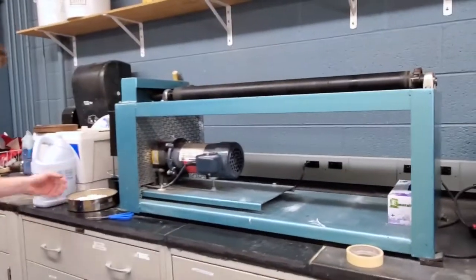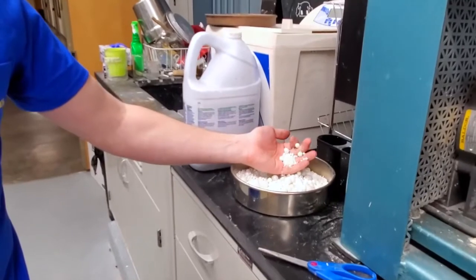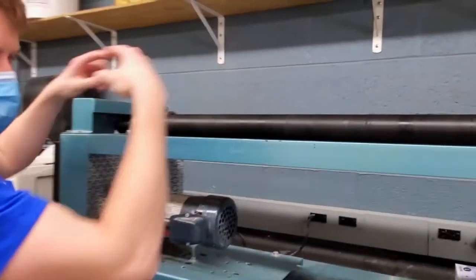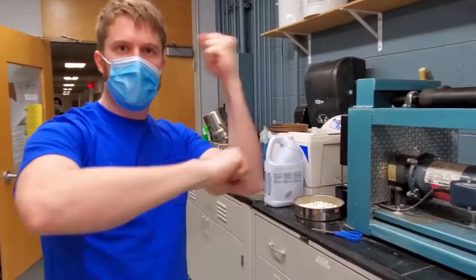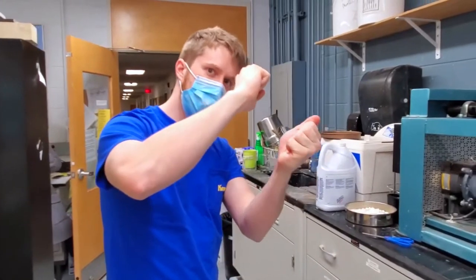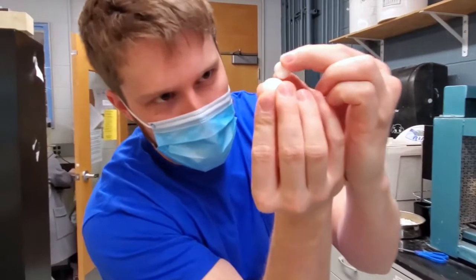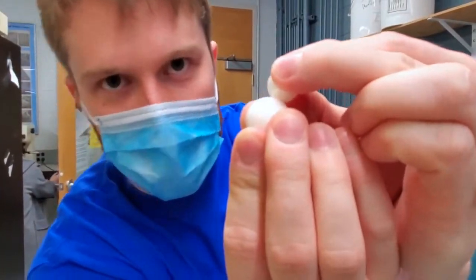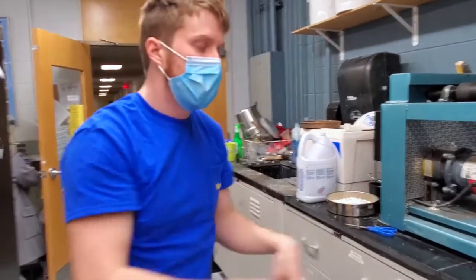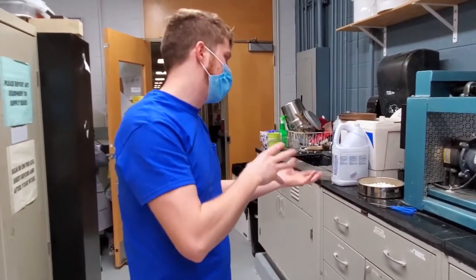So basically what ball mills are is you put in your material with these different little ceramic beads, and you put that into a container here that then just rolls. So those ceramic beads are bouncing around with your powder, and as they're falling against each other, the beads will hit one another, and any of your powder between those two beads gets crushed. So it's a way to make your powder finer and to get a more uniform distribution of particle size with whatever type of powder you're working with.